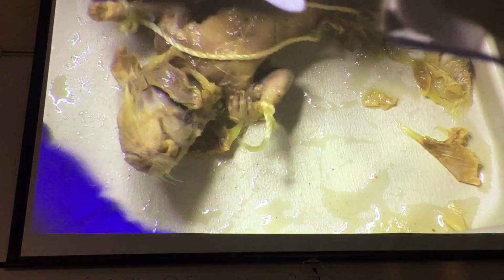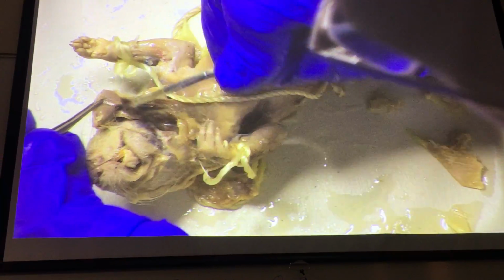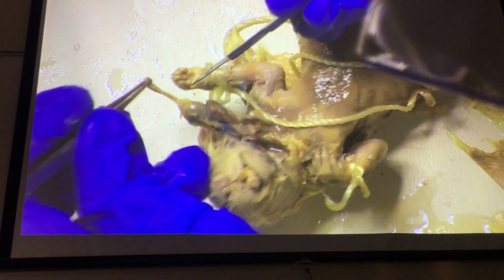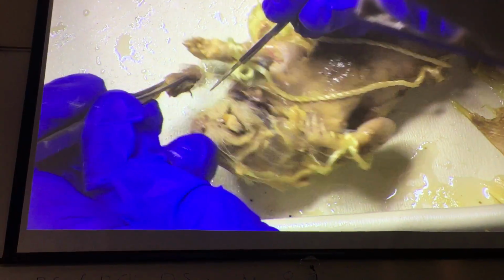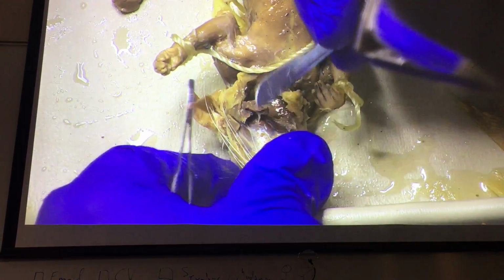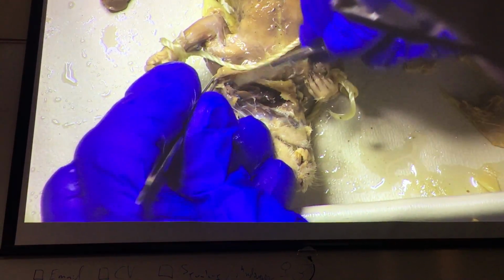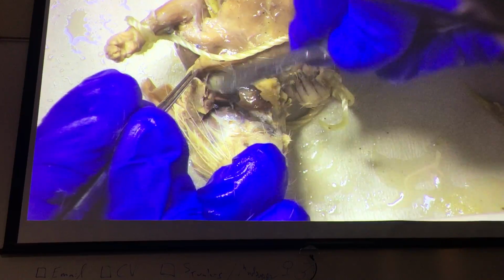And so, yeah, you gotta be careful in here because right in here is our external jugular. We don't want to lose that. And a branch of it's going to go onto the salivary gland. Now this particular salivary gland is not the parotid because we're below the mandible. This is called the submandibular, which is kind of a giveaway from its location.